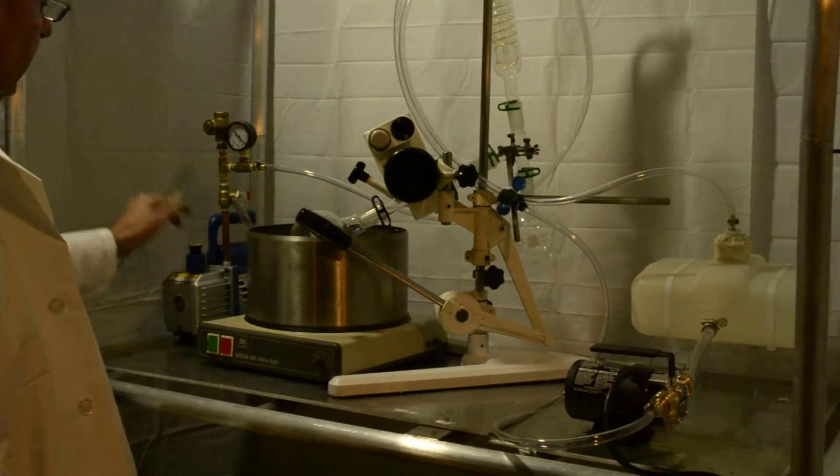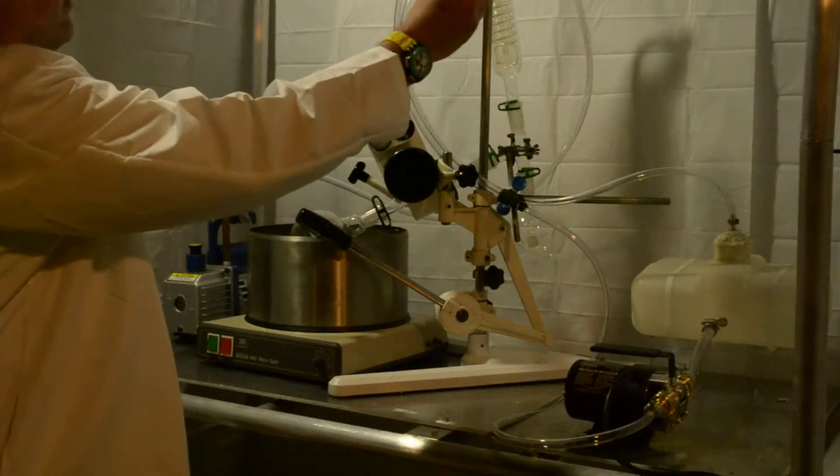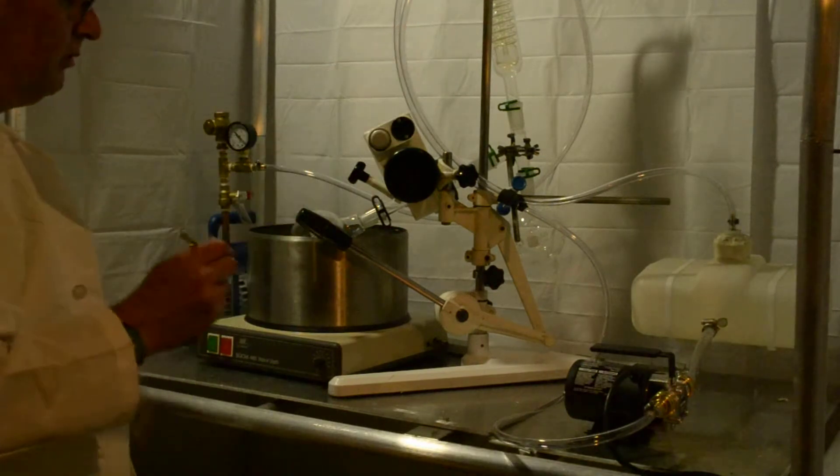Make sure and put your oil in the vacuum pump. That line's going to run right up here and make sure it's lock tied.